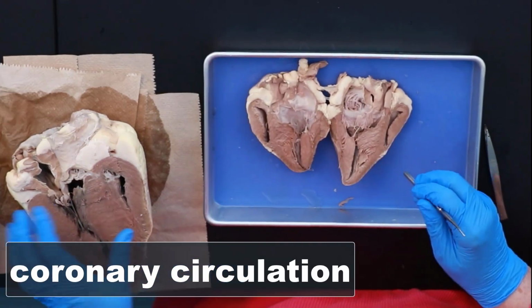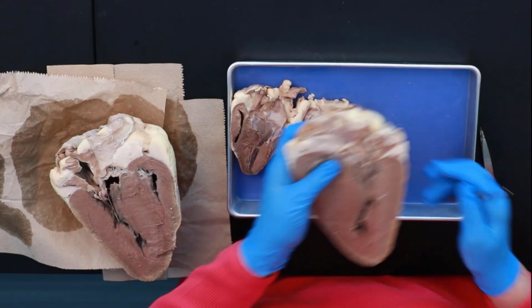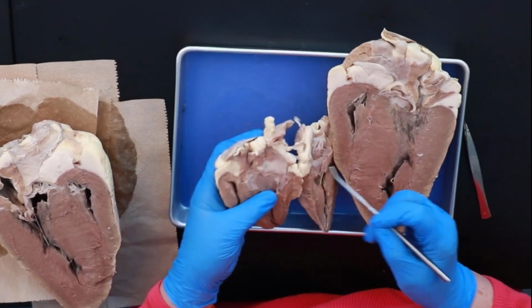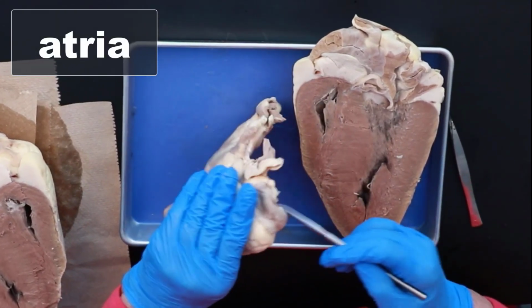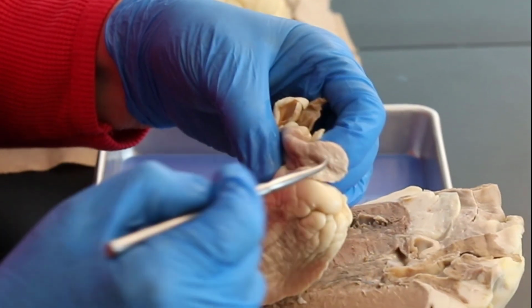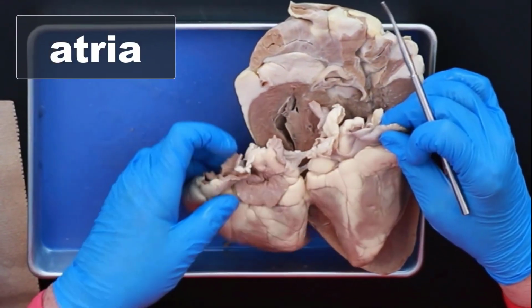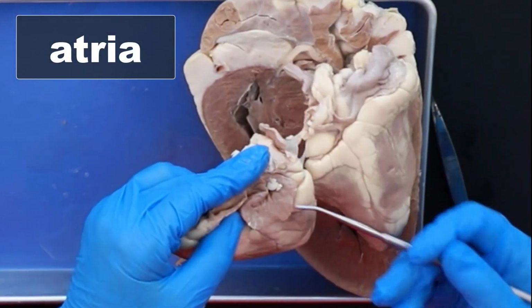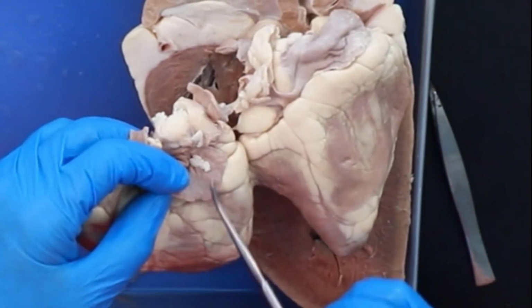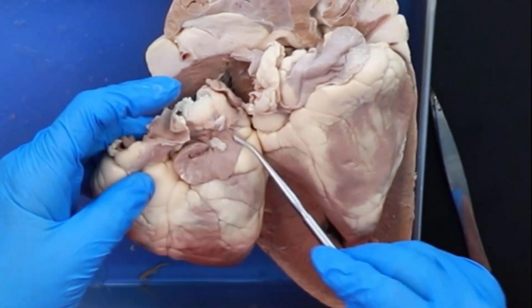circulation. And we're going to go back to the cow heart here, because basically if you look at this, here's your atria. You can actually see this really nicely. This is the atria here, and these little flaps are called the auricles. So this is an atria. This is an atria. You can see the little flaps, the auricles, and see how small the atria are compared to the ventricle. This is just a holding chamber.